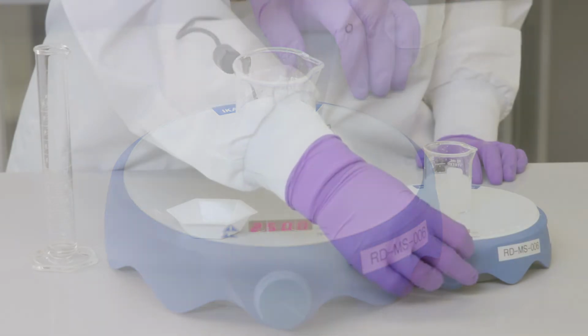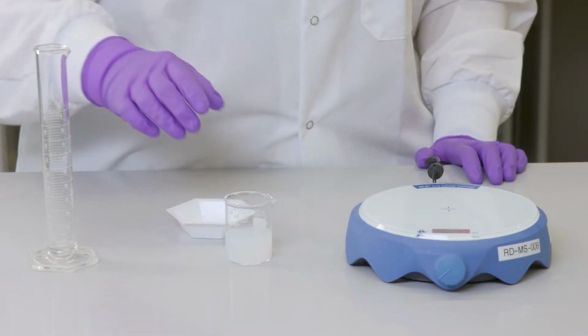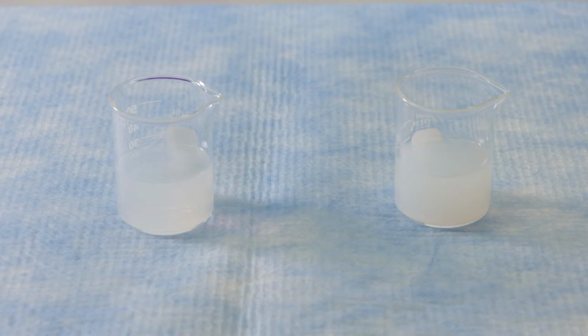If the milk isn't completely dissolved, you will be able to see particulates in your solution. Visually checking for particulates is the best way to determine whether milk is dissolved. You can also filter your milk to get rid of any undissolved particles.